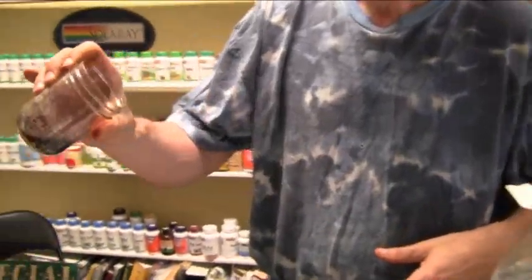Now what you do after you do this: filter it and then rinse it three or four times, because you've got to strip off the other stuff. Once you're done, put it in a glass container right away. Let it dry. Once it dries, put it in the container because it will evaporate in the air eventually. Don't put it in the oven — don't heat it. If you do heat it, don't heat it above 100 degrees because it will volatilize.